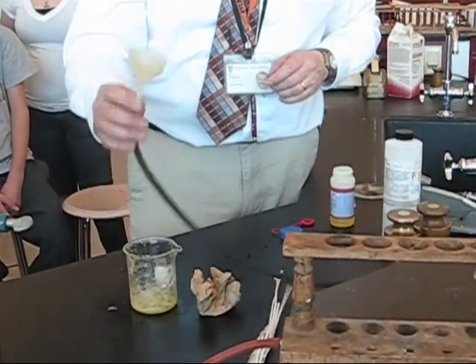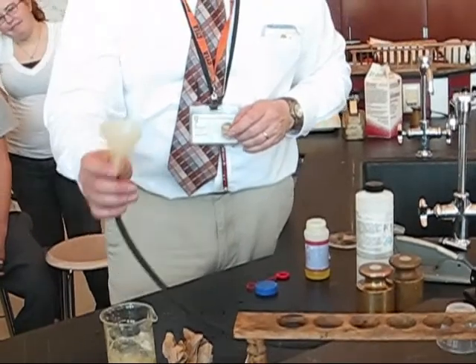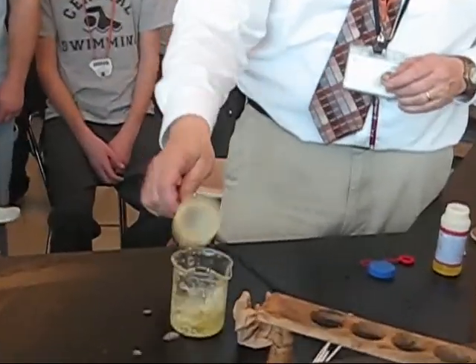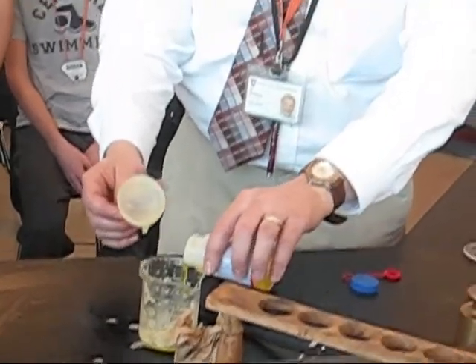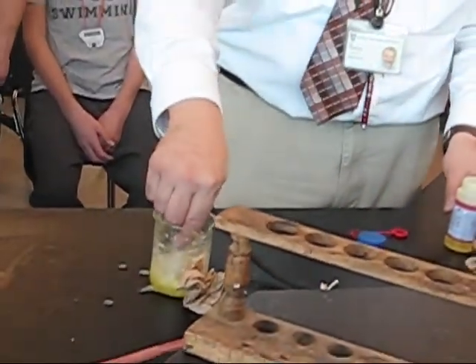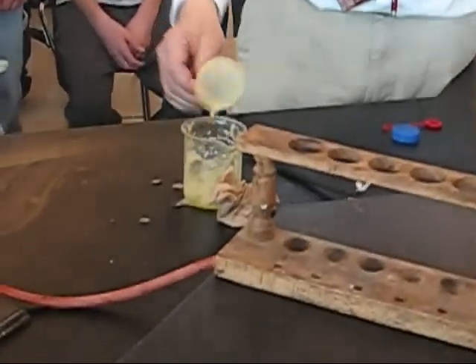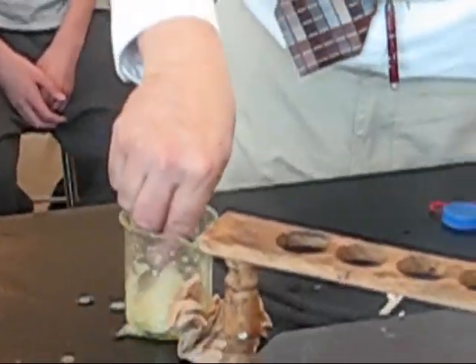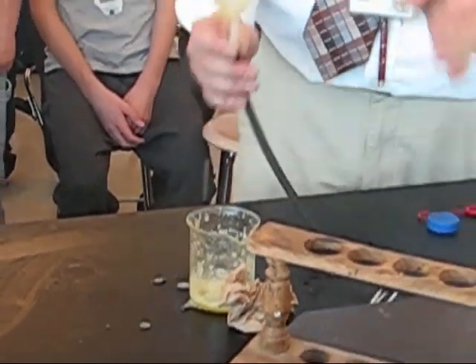I'm going to try to blow a bubble. I'm having trouble. Edit this out. I at least need one bubble — just need a bubble, please. One bubble is going to last. Okay, now there's a bubble. What happened to the bubble? It went up. It went up. It's less dense.